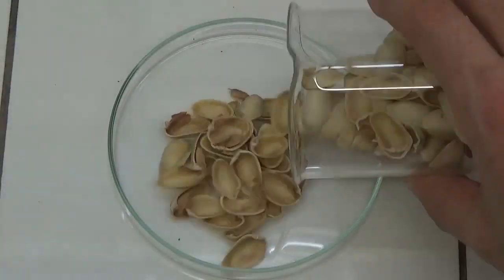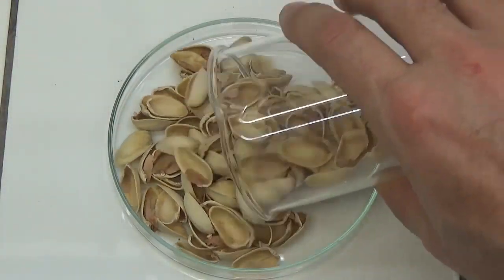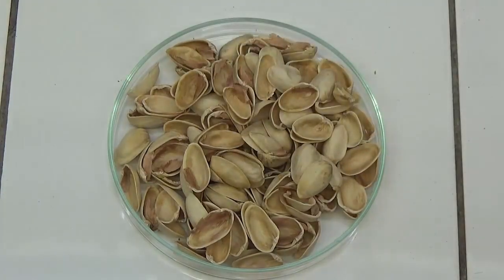In this video, we can see how to get furfuraldehyde using pistachio shells as a starting material.